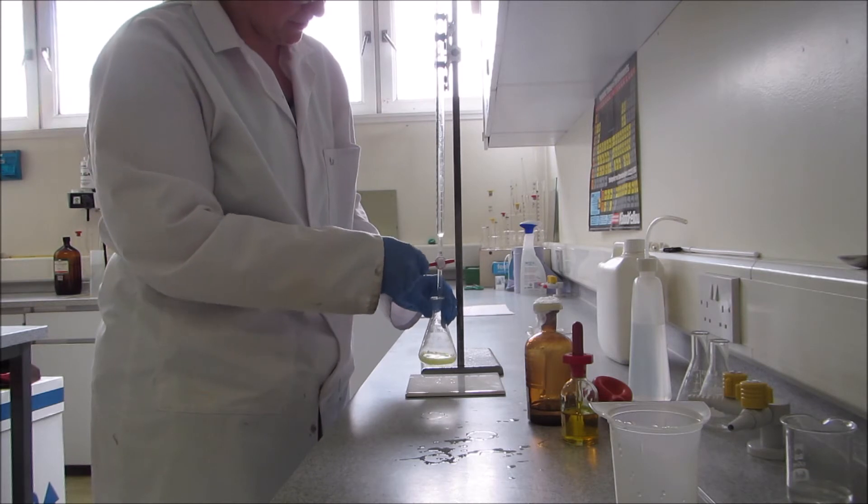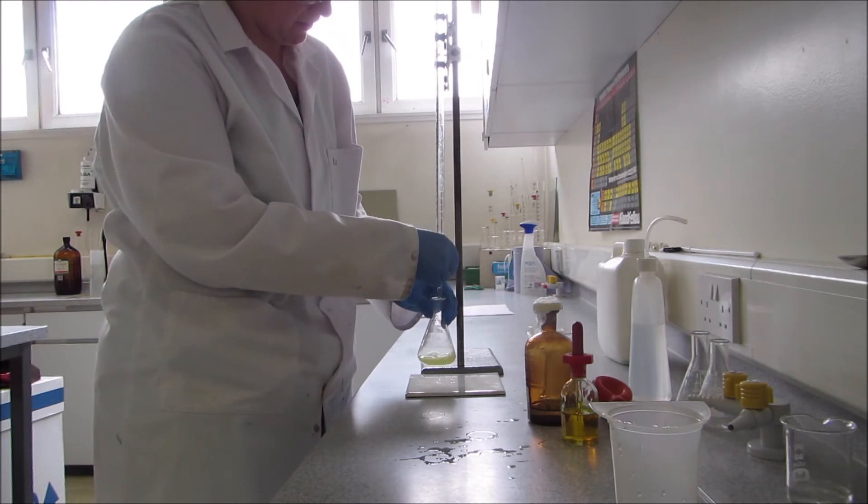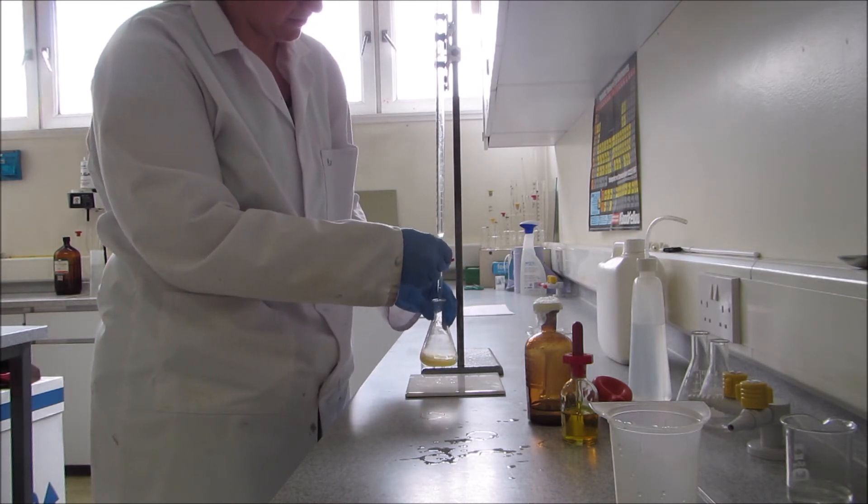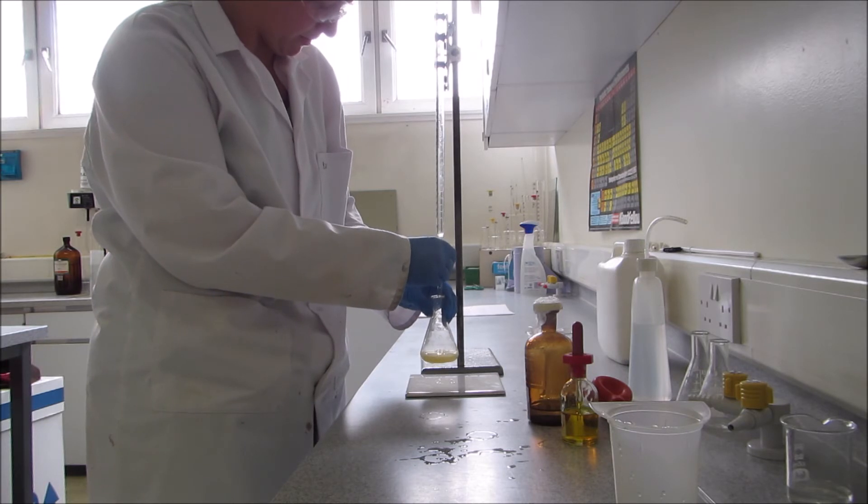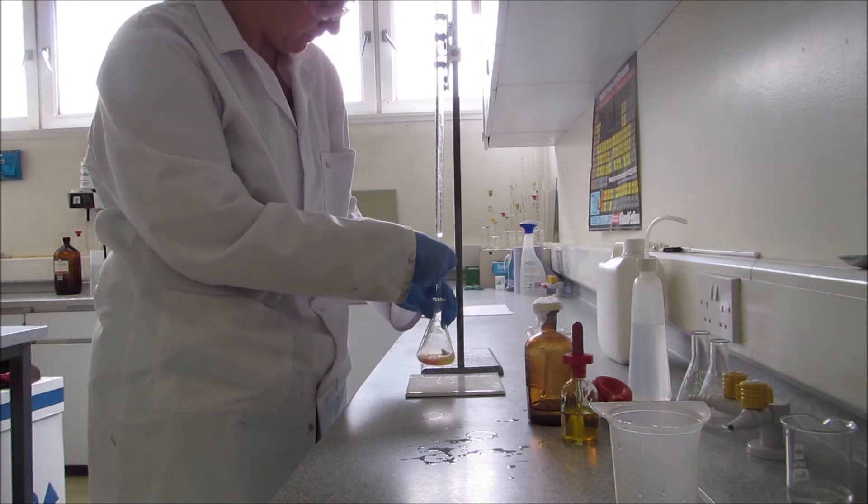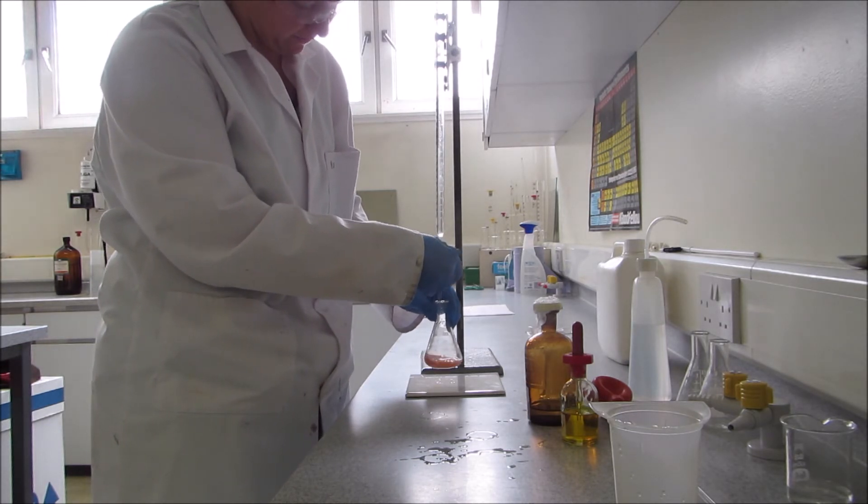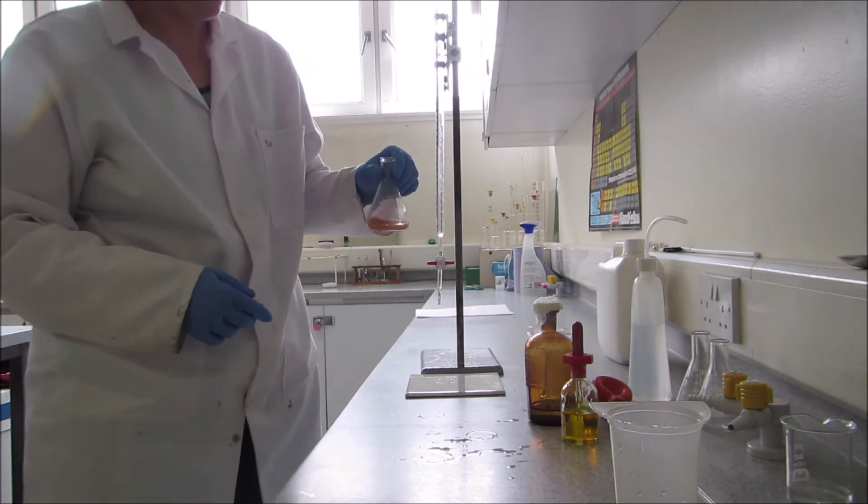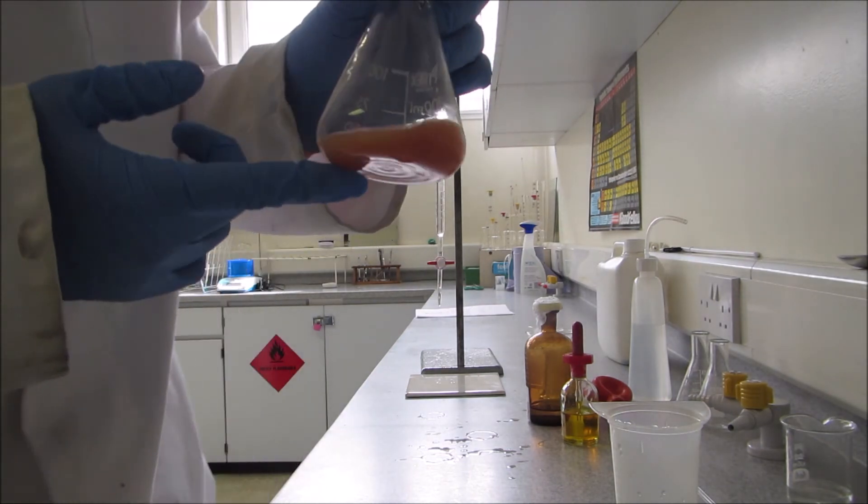Just add a few drops at a time. Pink color is starting to get harder to go. So I think I'm going to add just a drop. And now the pink color has stayed. That's the end point for this titration.